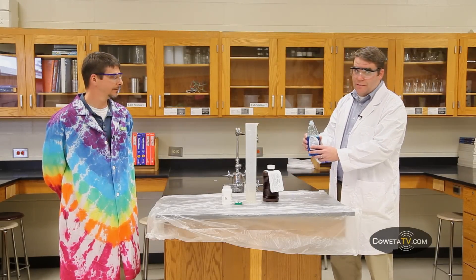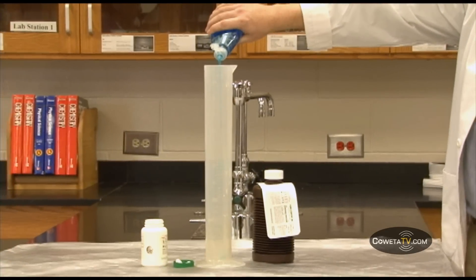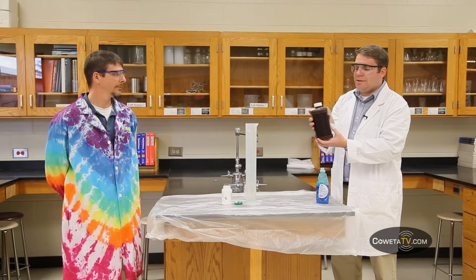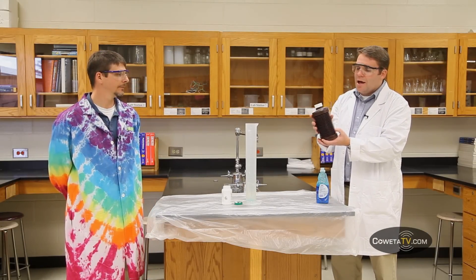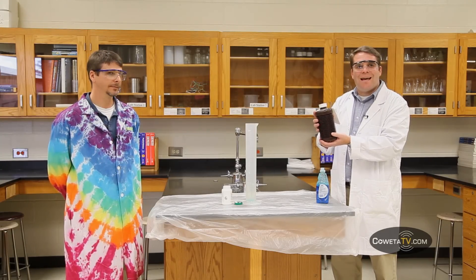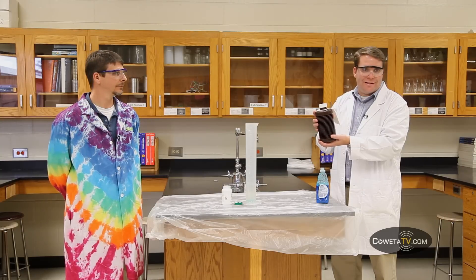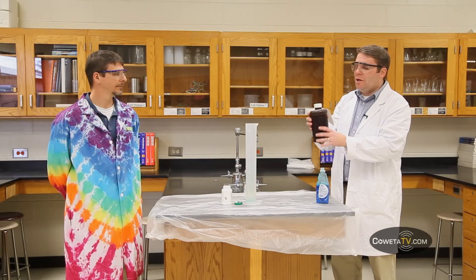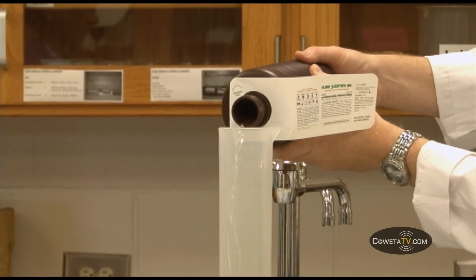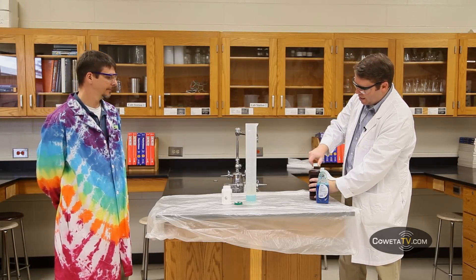The secret ingredient in today's reaction is dishwashing soap, so I'll add a little bit of that in there. Hydrogen peroxide is available readily, but this is 30% hydrogen peroxide — it's about 10 times the concentration of the hydrogen peroxide that's in your medicine cabinet or underneath your sink at home. So you can't get this one at home. I'll add a little bit of that in there, and Mr. Sewell is going to add our catalyst.